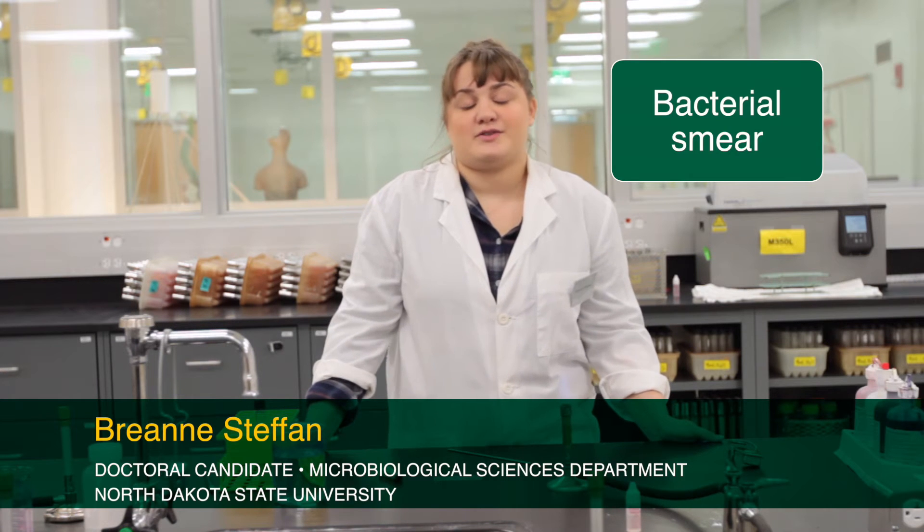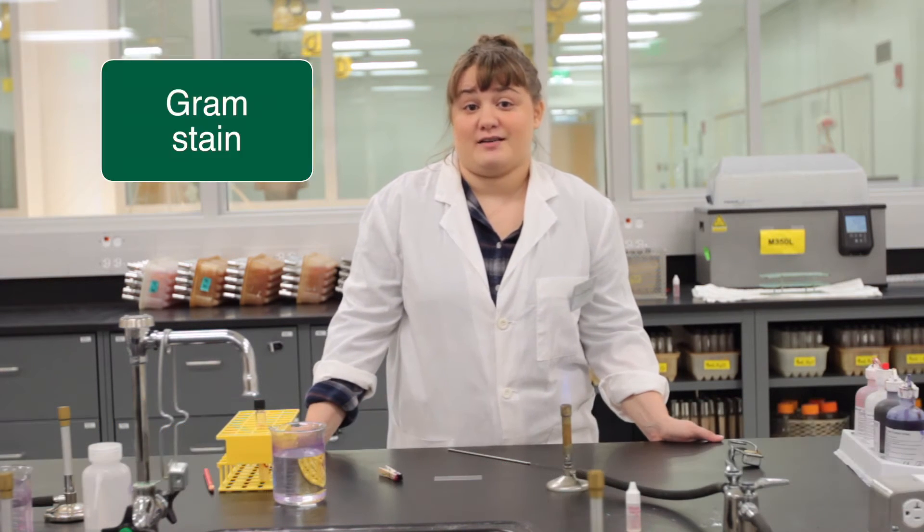Hello everyone. Today we are going to learn how to make a bacterial smear to do a differential stain called the Gram stain.